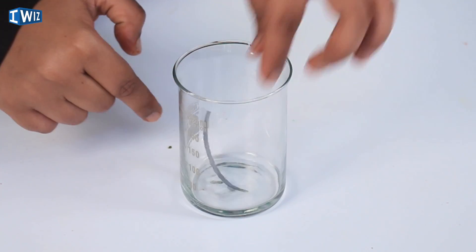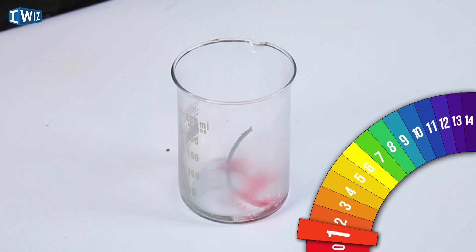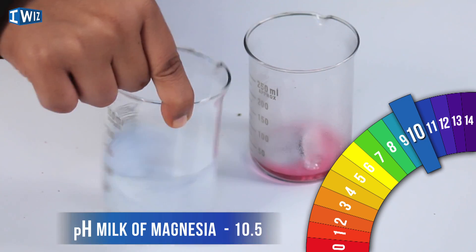Moving on to the digestive system — we have hydrochloric acid in our stomach, which is extremely acidic. The acid environment helps break down food: as I put a food particle in, you can see it disintegrating. Testing the solution confirms a strong red color, indicating a strong acid. If there is too much acid in our stomach we take milk of magnesia or antacid tablets — testing the pH of milk of magnesia gives a blue solution, which neutralizes the stomach acid.